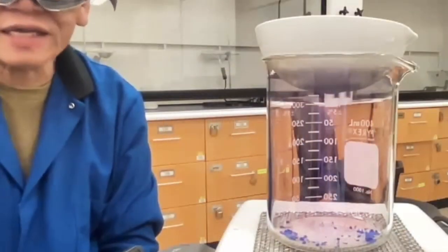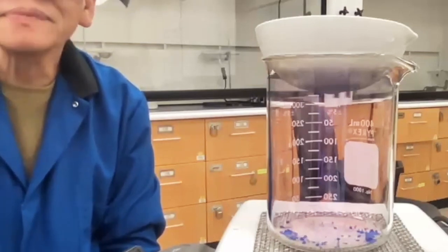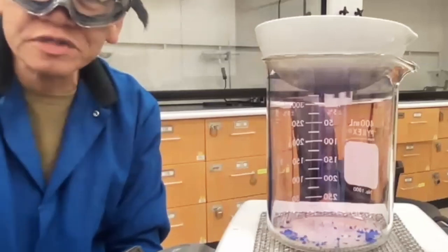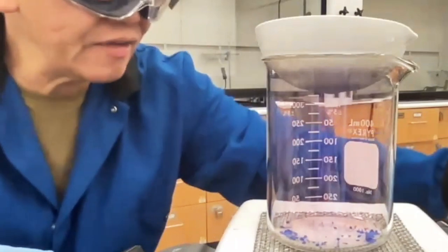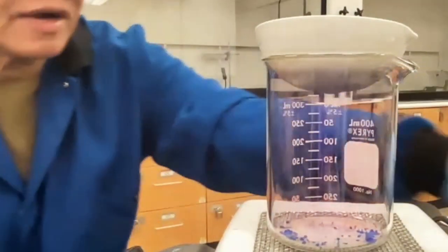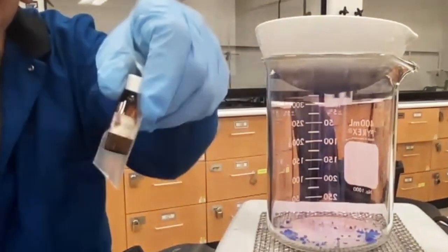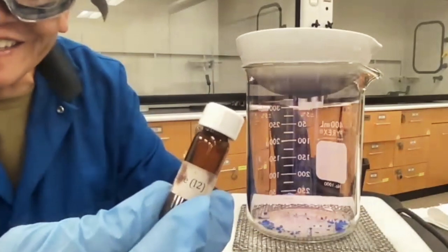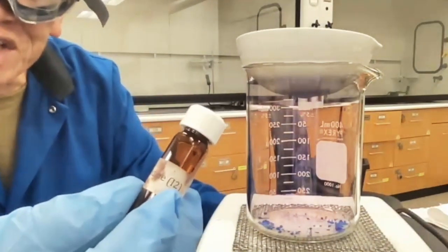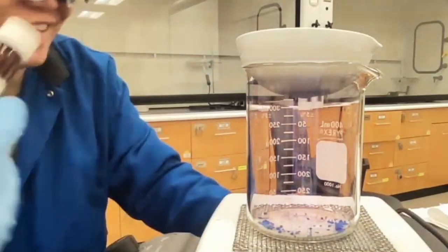Professor, for the iodine crystal, is this the same that we used from the previous experiment? Yeah, but you have 2 bottles. I think I only have 1 bottle. I gave you 2 containers like this that was in your baggie. Yeah. There should have been 2. It doesn't say 12, it says I2. Okay, that's the problem. I thought it's 12. It's a subscript. So I2 means I and then 2. Okay. Sorry. No problem.